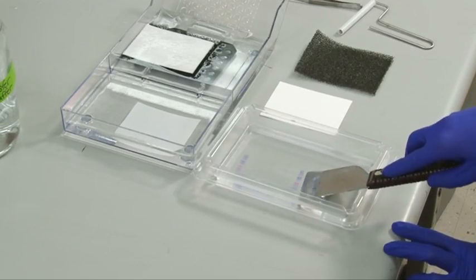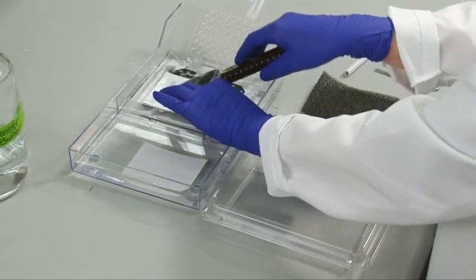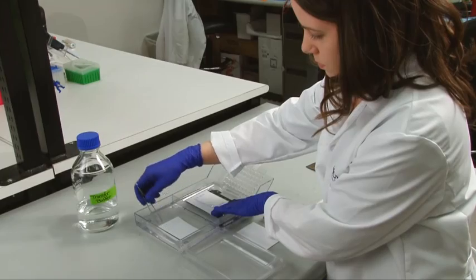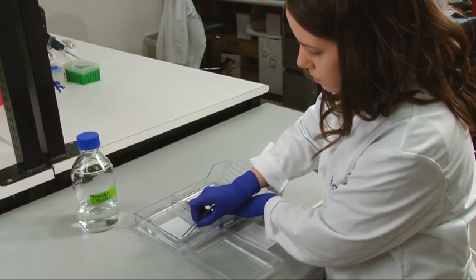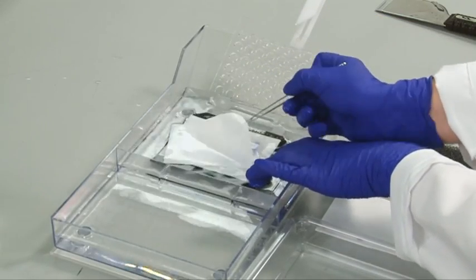Be careful not to touch the gel or membrane with your bare hands and use clean tweezers or spatulas instead. Touching the membrane during any phase can contaminate the blot and lead to an excessive background signal.